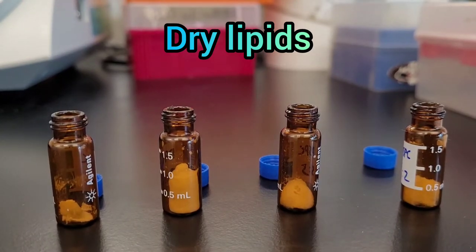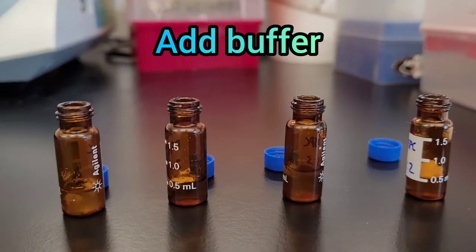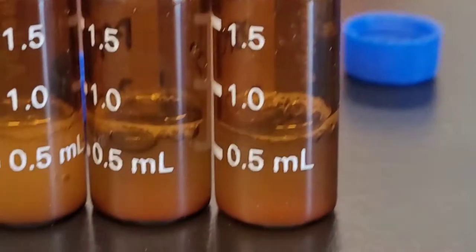Today we are doing lipid extrusion. First you need your dry lipids and add your buffer to it.